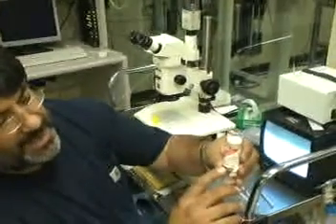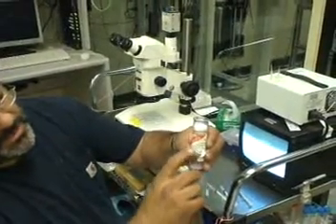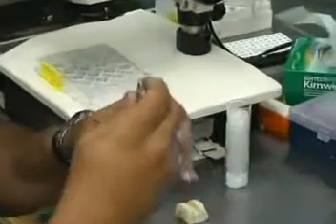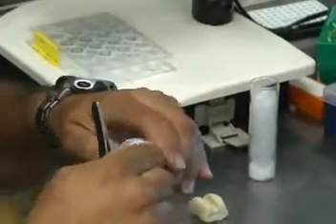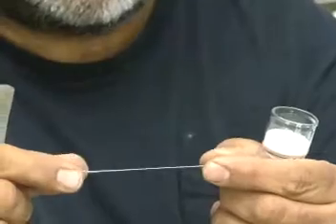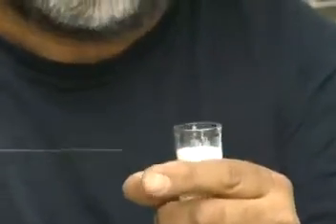You need a 0.5 millimeter either quartz or glass capillary. They come in a little box sealed, and the capillaries are wide on one end and skinny on the other end, and they are sealed. That's a glass or quartz capillary.